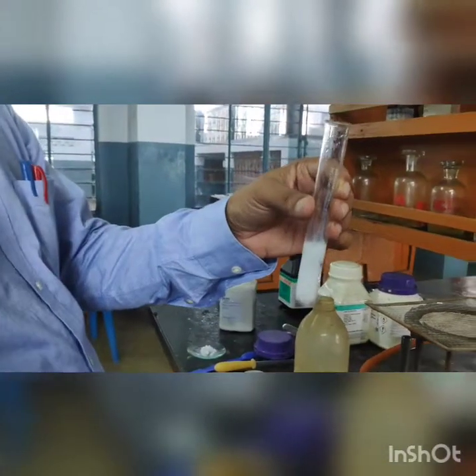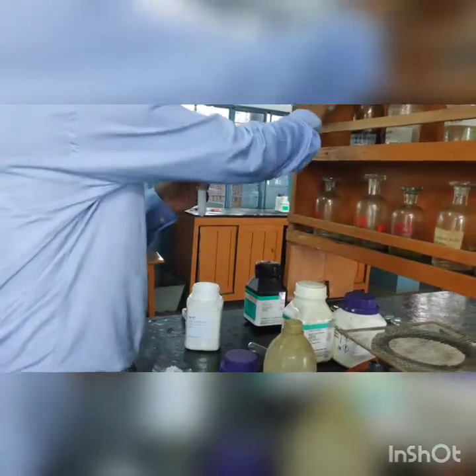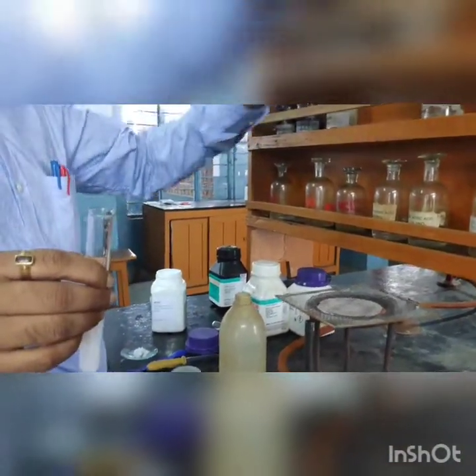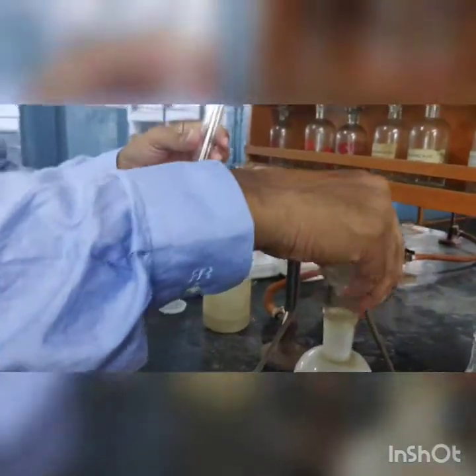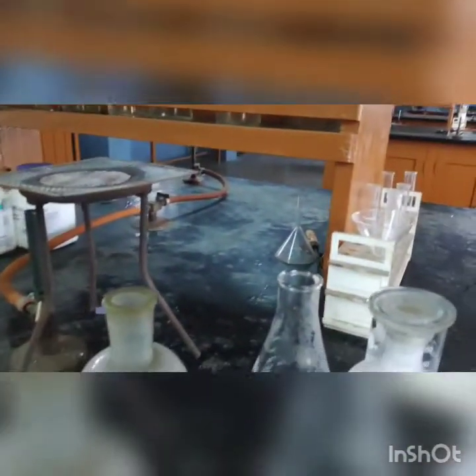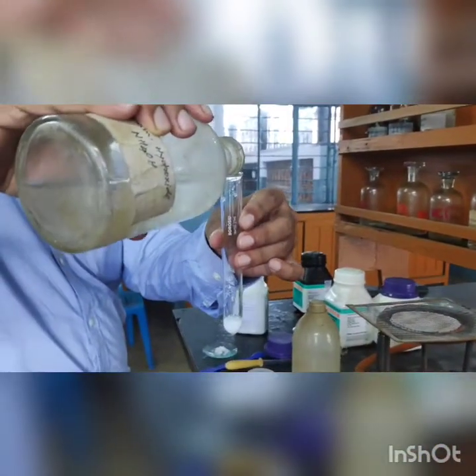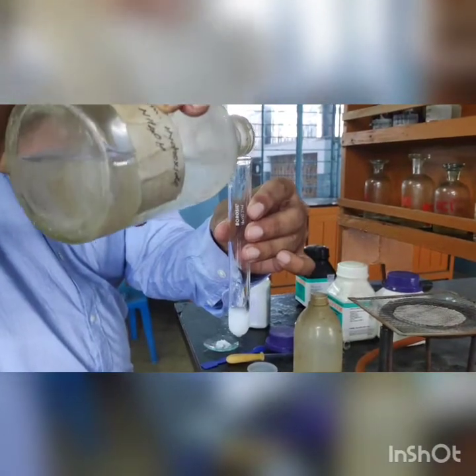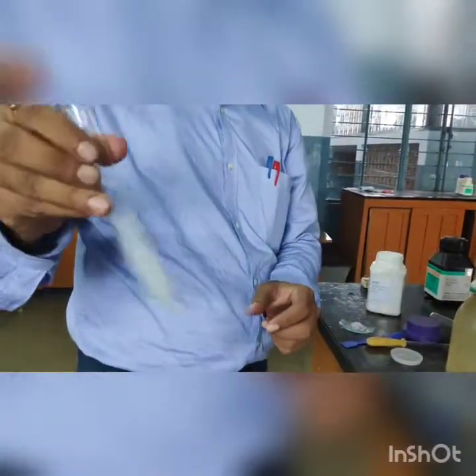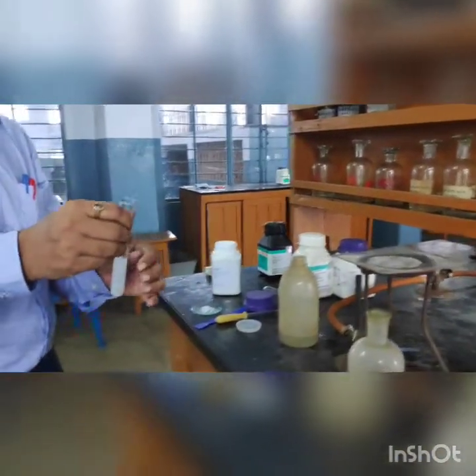Again there is formation of a white precipitate. This white precipitate can be further confirmed to be a chloride because when excess ammonium hydroxide is added, upon adding excess ammonium hydroxide it dissolves. Therefore the chloride ion has been confirmed in this particular salt.